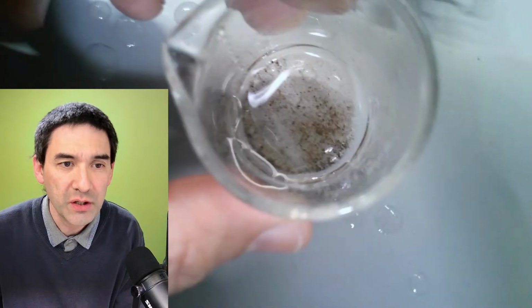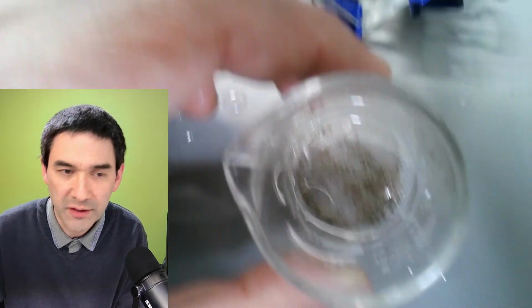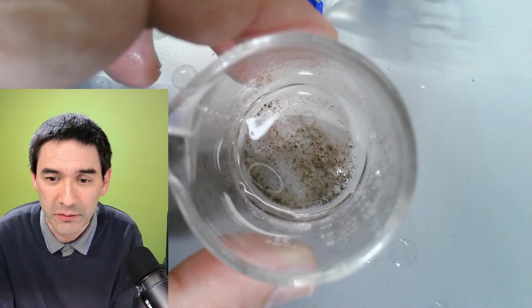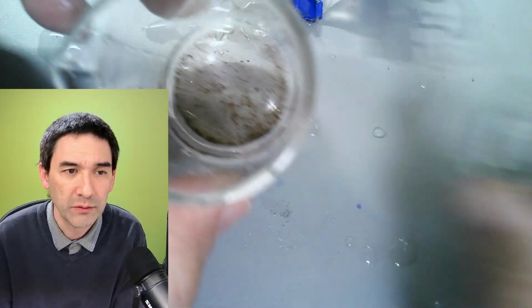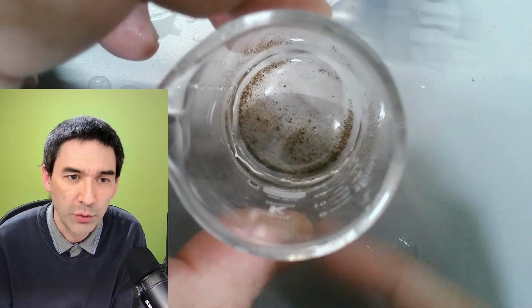So there are, of course, lots of soil particles and things that have come off, and usually water bears and other microorganisms like to be where there is solid material. Especially the water bears like to cling to solid material, right? So here, that's basically the one that I collected before. Then what you probably want to do is wait until all of these particles collect in the corner over here.